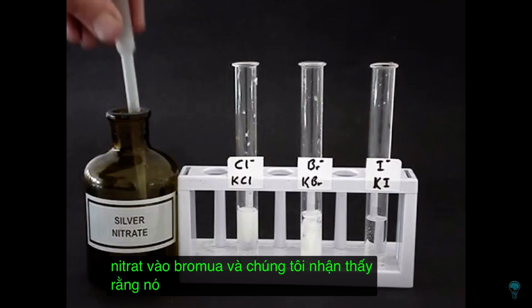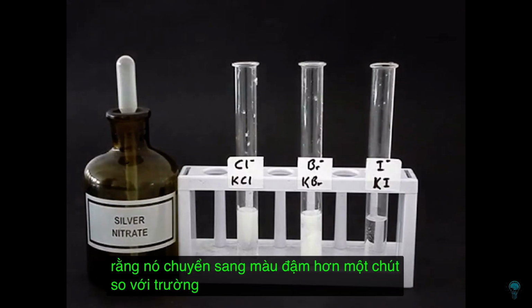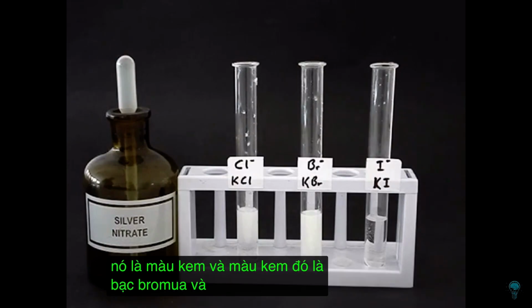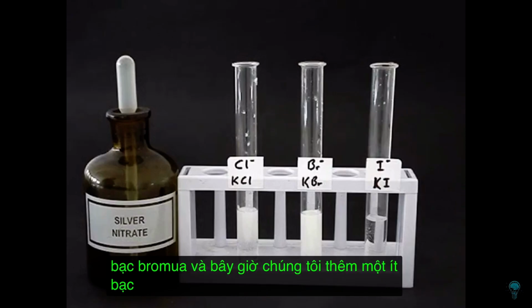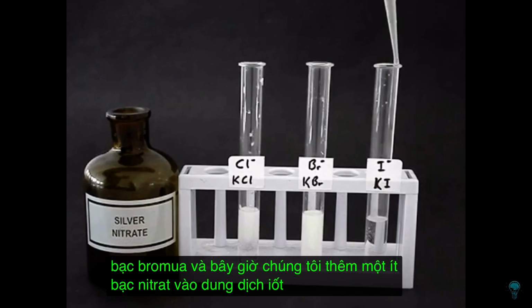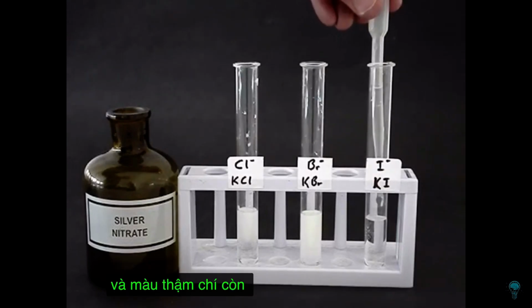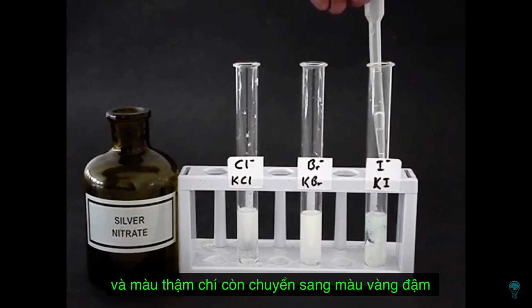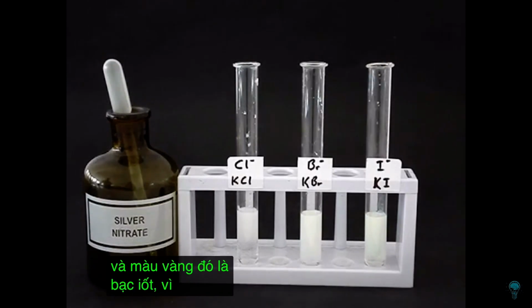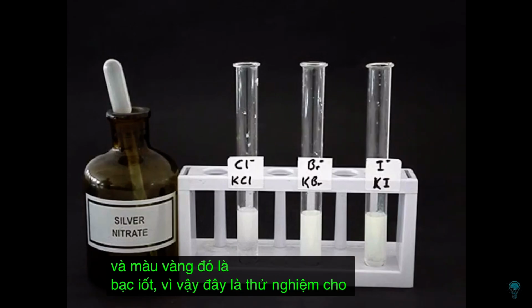and we notice that it turns a bit of a darker color than in the case of the chloride. We call it cream colored, and that cream color is silver bromide. And now we add some silver nitrate to the iodide solution, and the color turns even darker, yellowish, and that yellow color is silver iodide. So this is a test for each of these halides.